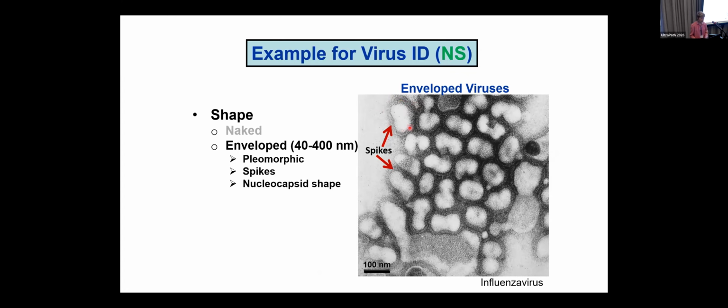This particular virus, this is flu, in some cases may look like a kidney, it may look like a peanut, and it may look like this big animal cracker down here at the bottom of the screen. So envelope viruses are usually pleomorphic because they have this soft, pliable membrane on the outside. In addition, all of the envelope viruses have some structure on the outside. Sometimes it's easily seen by electron microscopy, and we call them spikes in the negative stain.